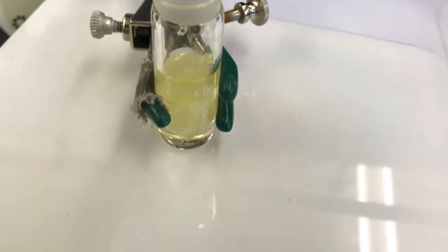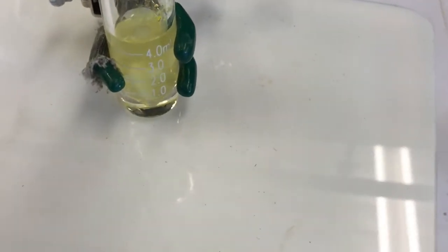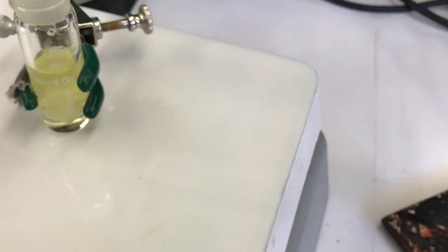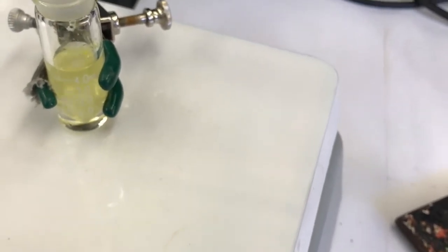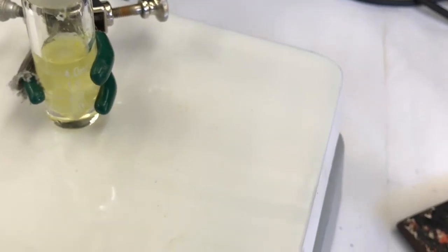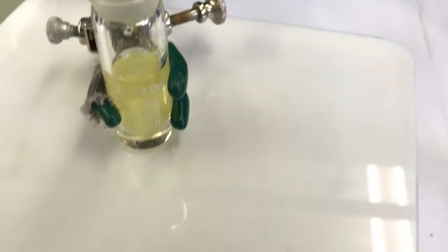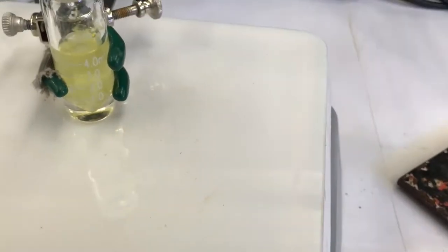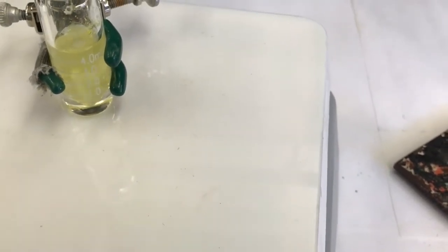So my guess on this experiment is that the reaction is stopped. I believe what's going on is that the sodium borohydride I've added to this reaction wasn't very pure. Even though if I take the mass of sodium borohydride that I added and figure out moles, it'll seem like I have an excess, I don't think I did, because that sodium borohydride was kind of old. It's probably hydrated and I was weighing out water as well. So I'm gonna go with that I didn't have quite enough sodium borohydride for this reaction. I'm gonna add a little bit more and then take the TLC of that. So let's go get some more sodium borohydride.